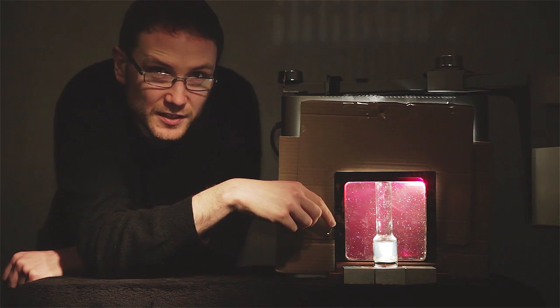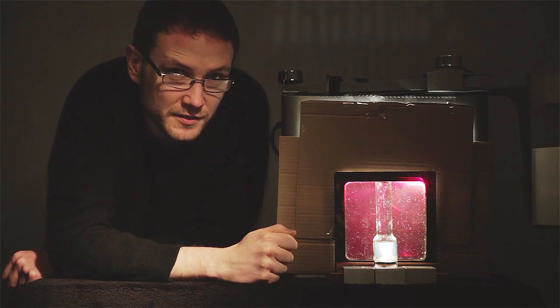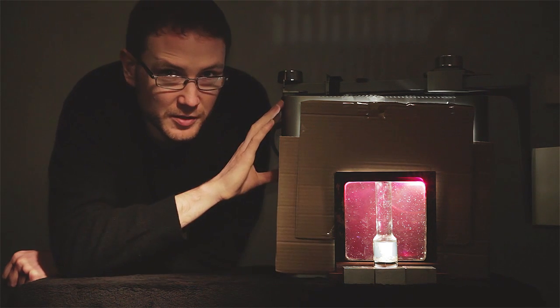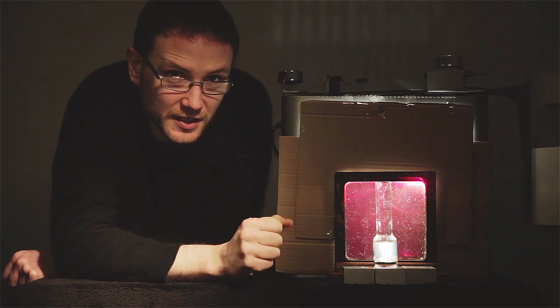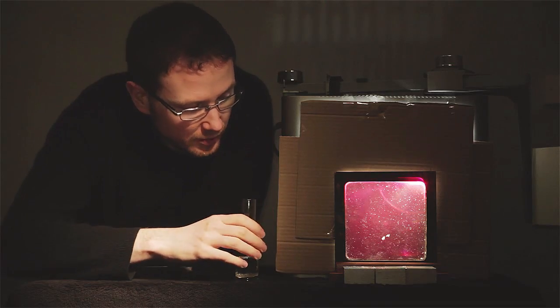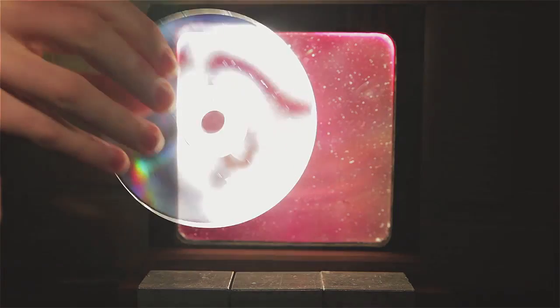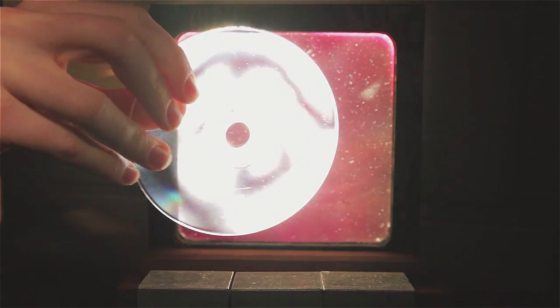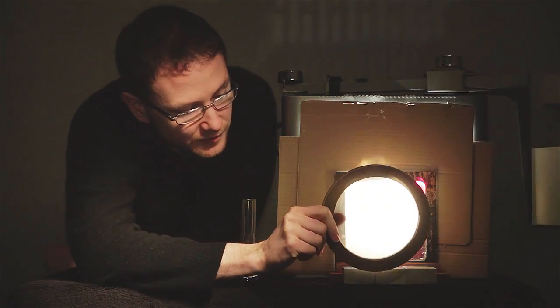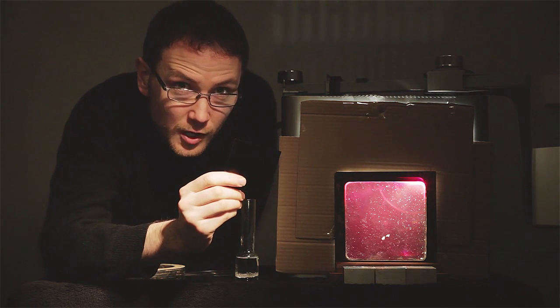This is a polarizing filter I've borrowed from the physics department. There's a second polarizing filter mounted to the front of the lens, so in theory there shouldn't be any light coming from the OHP getting through to the back of the camera. The physics departments are probably going to have some of these filters lying around. They're used for showing things like stress patterns in plastic. You can either mount another large filter directly in front of the light source, or you could pass out smaller filters for your viewers to hold.